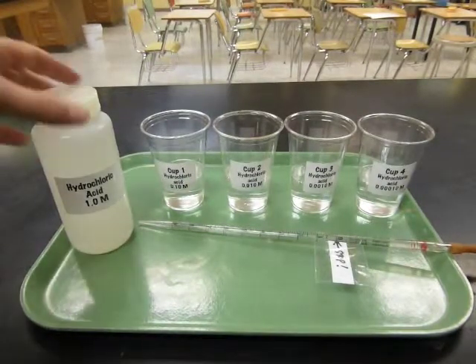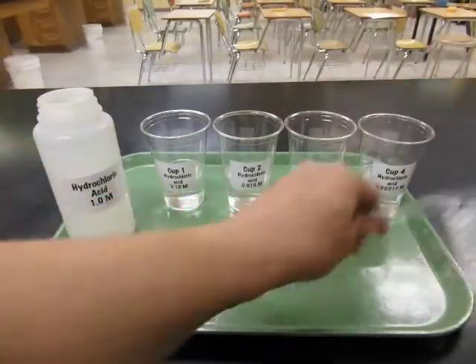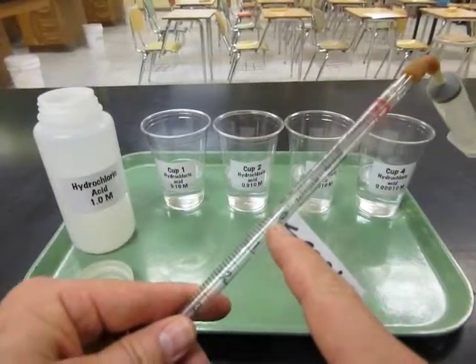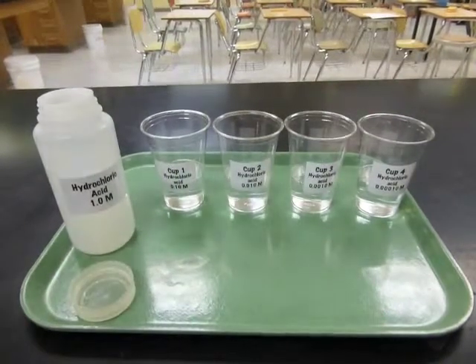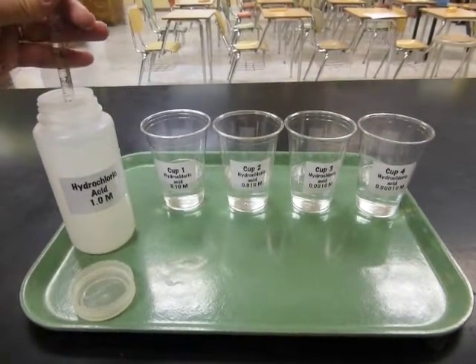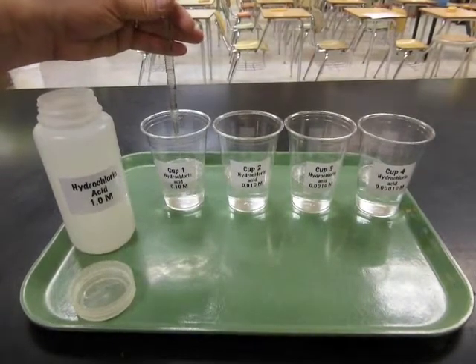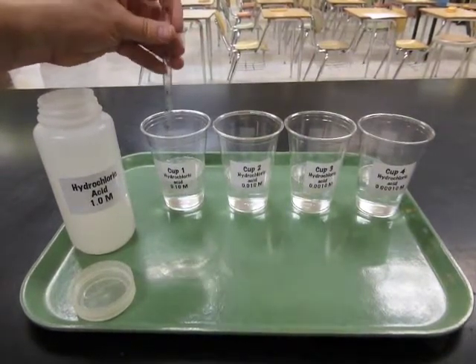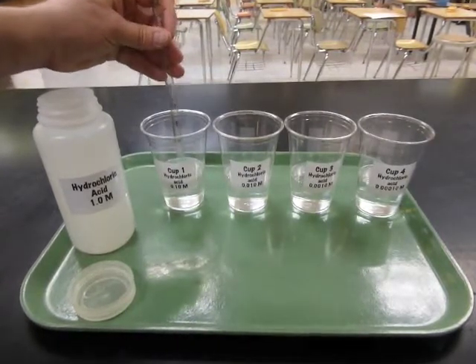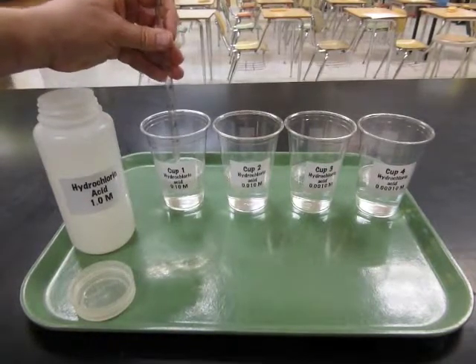And then take the acid solution, our starting solution, and a pipette. The pipette is marked where to stop measuring for exactly 10 milliliter volume. And put 10 milliliters into the first cup. And when we do that, it's going to add up to 100 milliliters. There's already 90 in there. So this 10 makes 100. And so 10 of those 100 milliliters is the acid that I started with. That means I've chopped the concentration by a factor of 10.